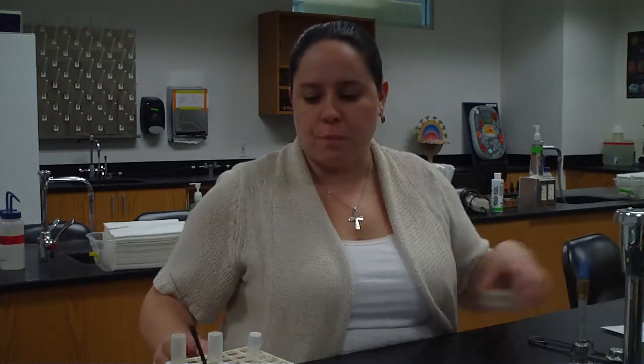The other thing is, while the flame may only go up to about right here, it's hot all the way up above it. So we're not ever reaching over the Bunsen burner. You may want to get something on the other side, ask somebody to pass it to you, or go around. Make sure you're never reaching over. The other reason for not having loose clothes and things like that is that we don't want to catch anything on fire. So please be very careful when you're using your Bunsen burners.